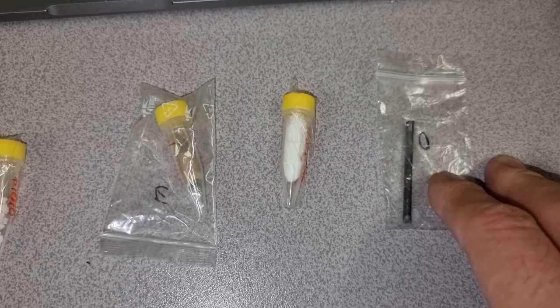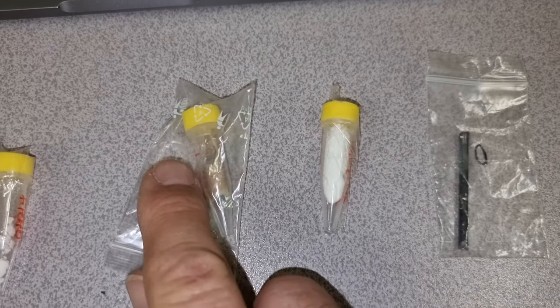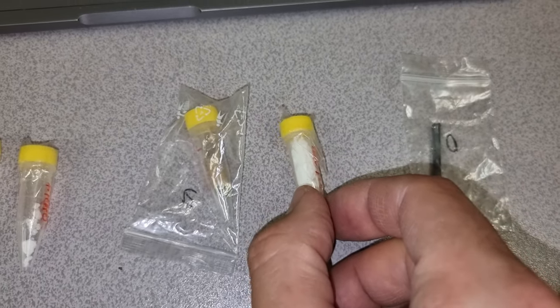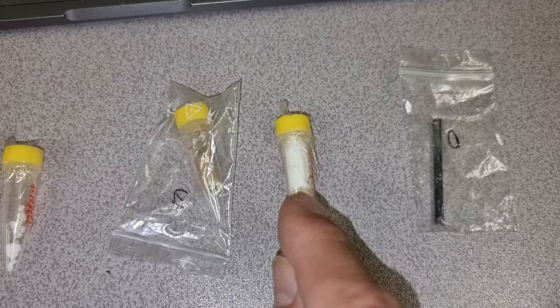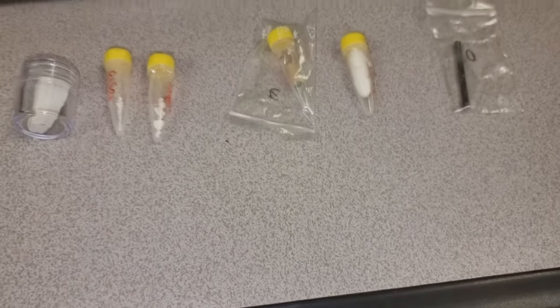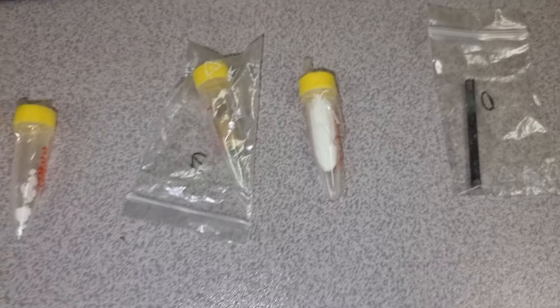This is the one in Japan. We took a segment from that and tested it with this tube, and also using a mask filter — in fact exactly the same mask filter that we used in Japan — we are going to look at the particles that were captured from this. Underneath that there was a carbon block which we've got in here and that has some deposits on it, so we're going to have a look at that as well. Those are the things we're going to predominantly look at.